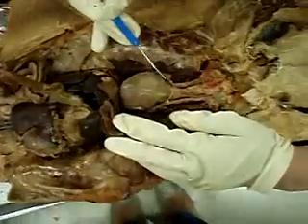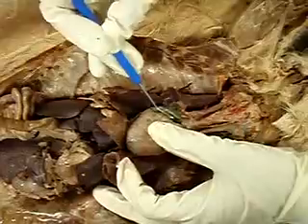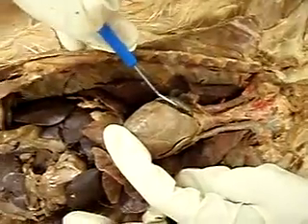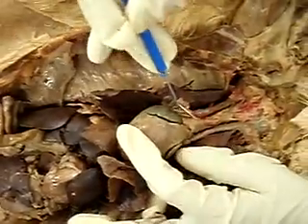Go ahead. Okay, so here's the heart, and you have these little ear flaps. I call them ear flaps. They're like little pieces right there and right there. Those are the auricles. Since this side is higher, this is the more superior. This is the right auricle. This is the left auricle right there, the ear flaps.